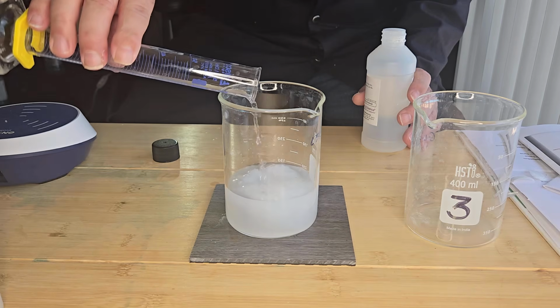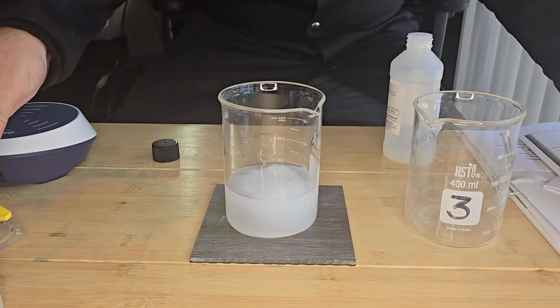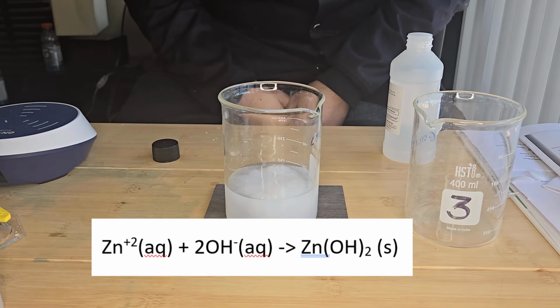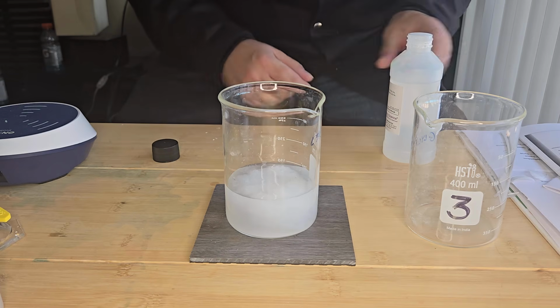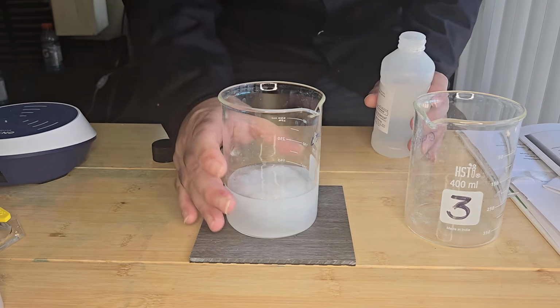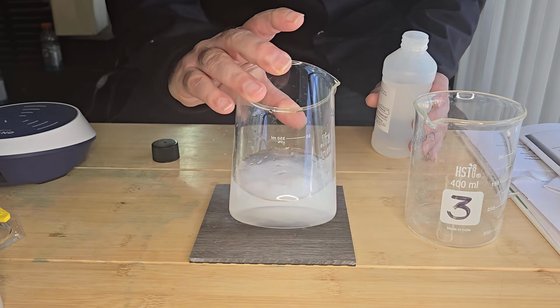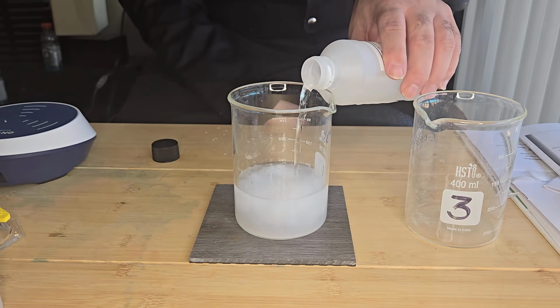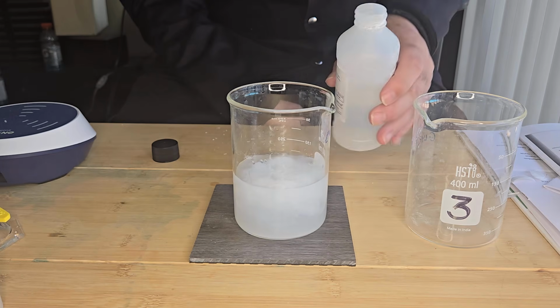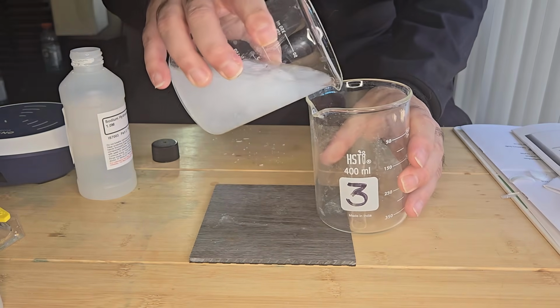So with the limited sodium hydroxide, I get a precipitation. Hydroxide ions react with zinc ions to form zinc hydroxide, which is a white gelatinous precipitate. This is the ampholyte in action. And as you can see, it's a solid gelatinous precipitate. When you add an excess of hydrogen ions, which I'm going to do in a minute, but first I'm going to split the precipitate.